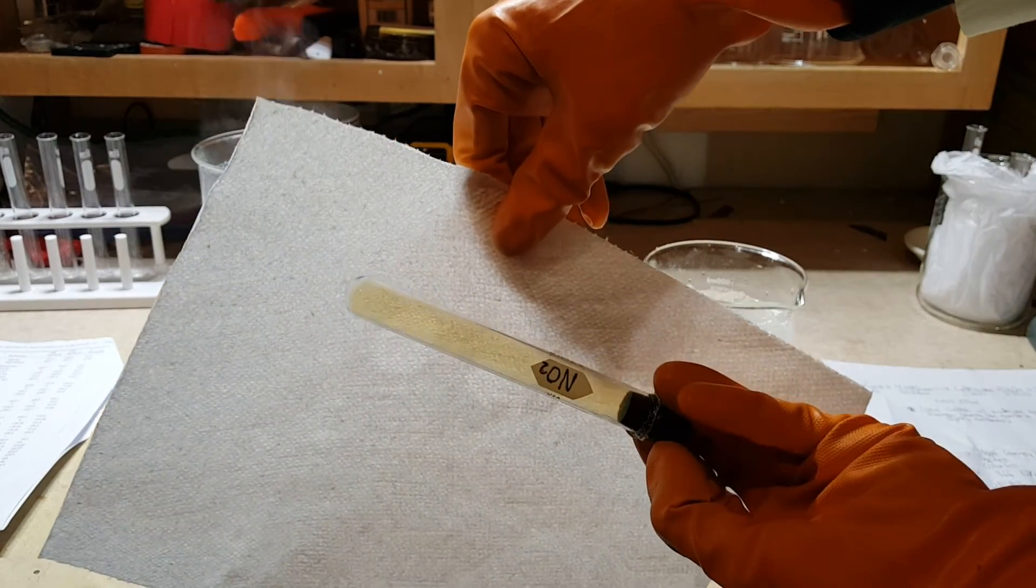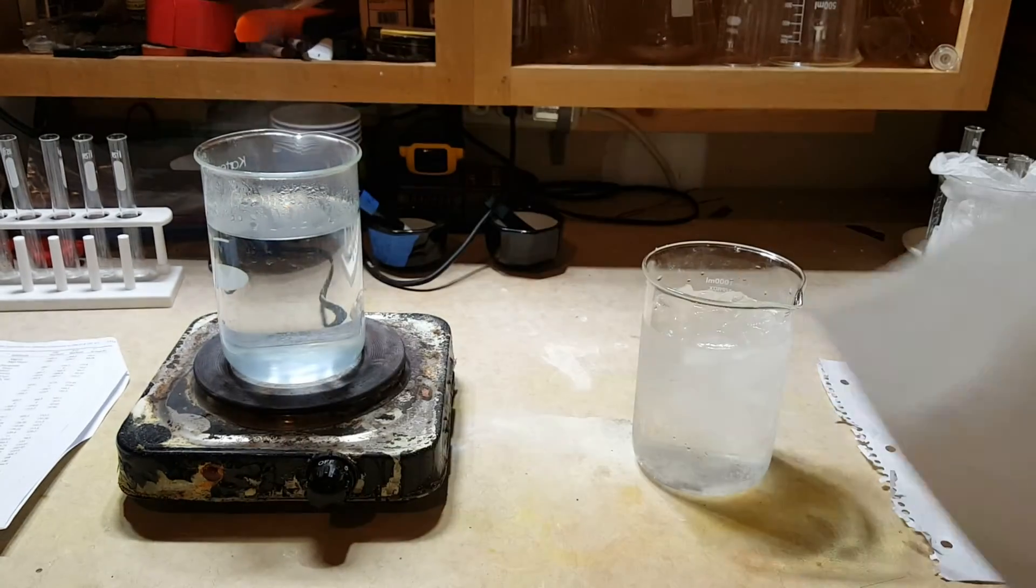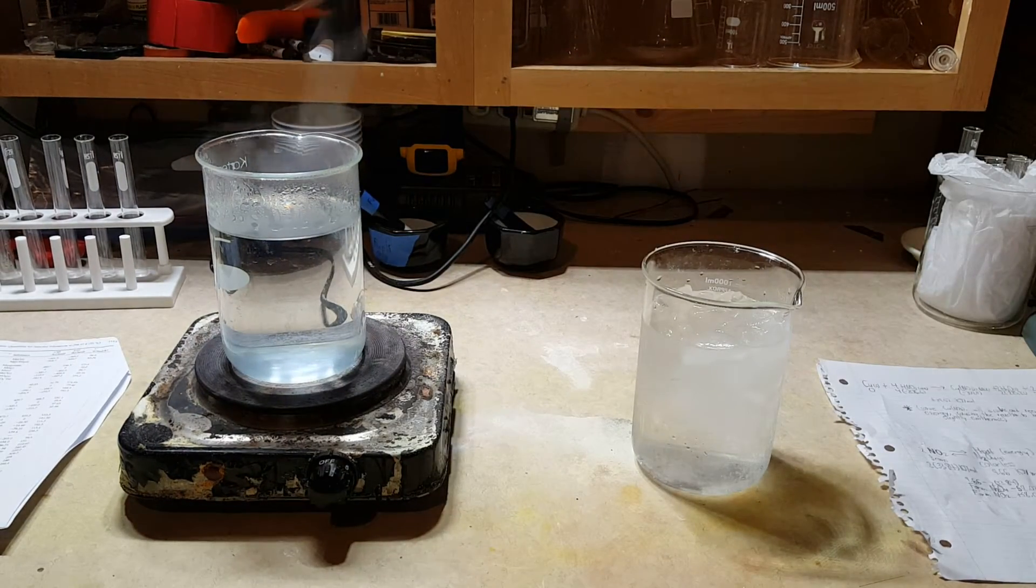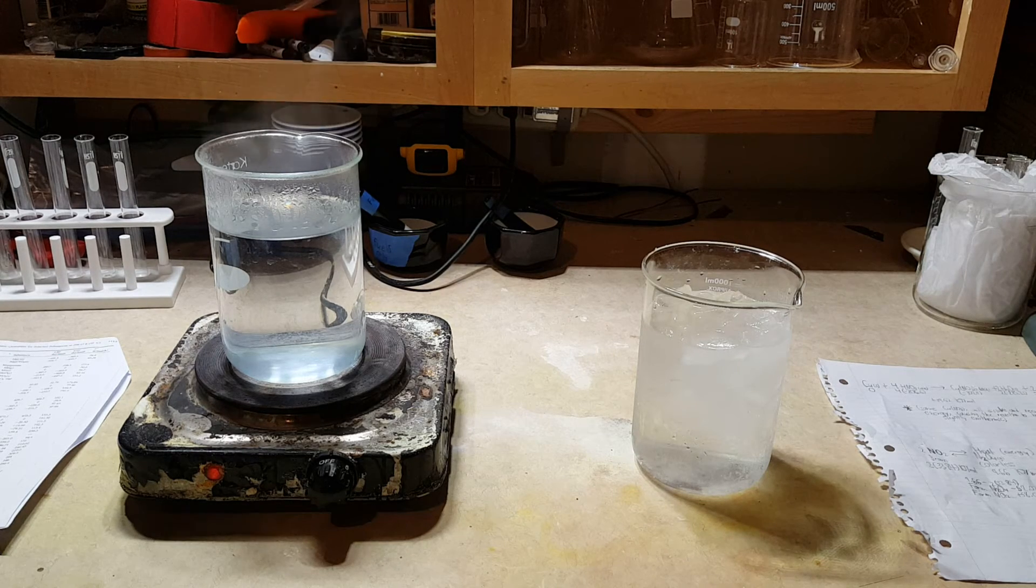Alright, so almost colorless now. Alright, so let's shift our equilibrium towards the brown gas, the nitrogen dioxide, by adding heat.